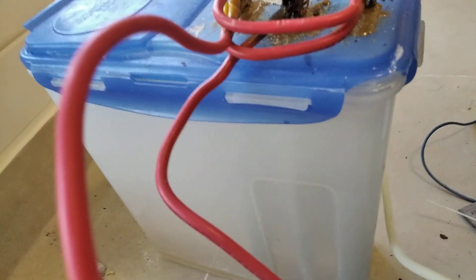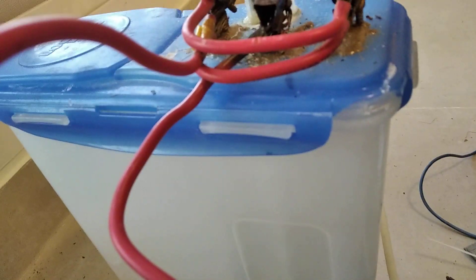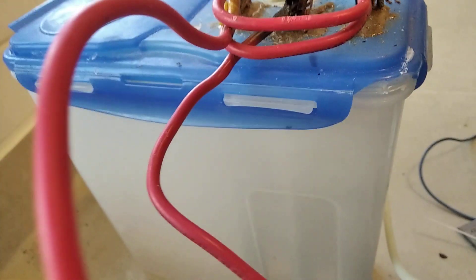So at that, this cell will be done in 4 days. But I'm obviously not going to run this to full completion because that would damage the electrodes. You only want to run this to about 70% conversion.